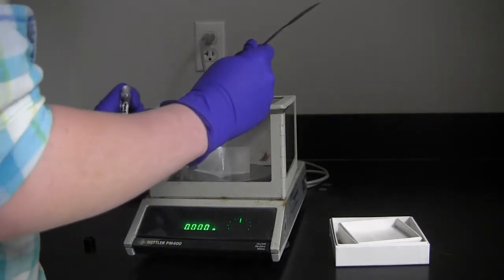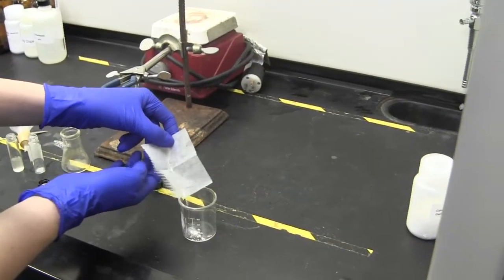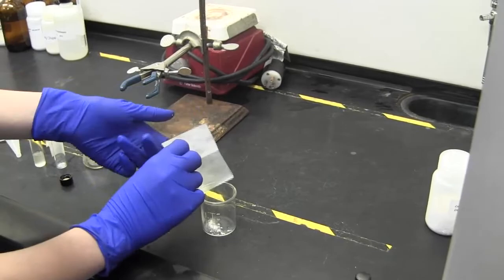Be sure to convert your units correctly before weighing your sample. By bending and tapping the weighing paper, it is easy to transfer the sample into your glassware.